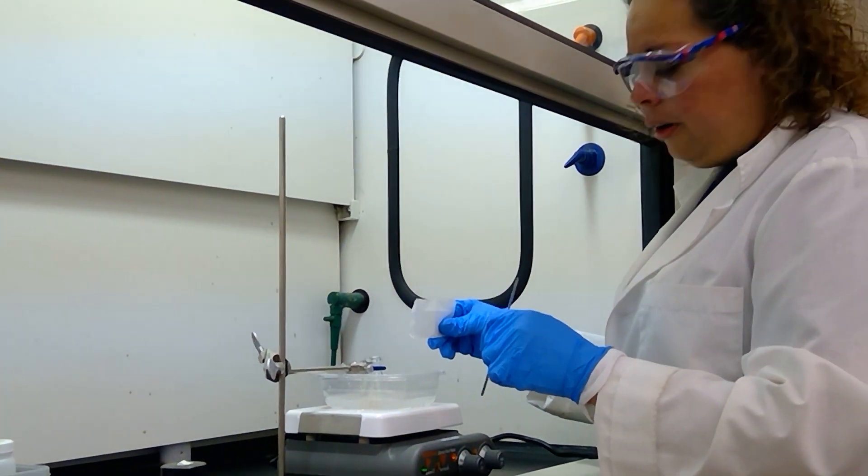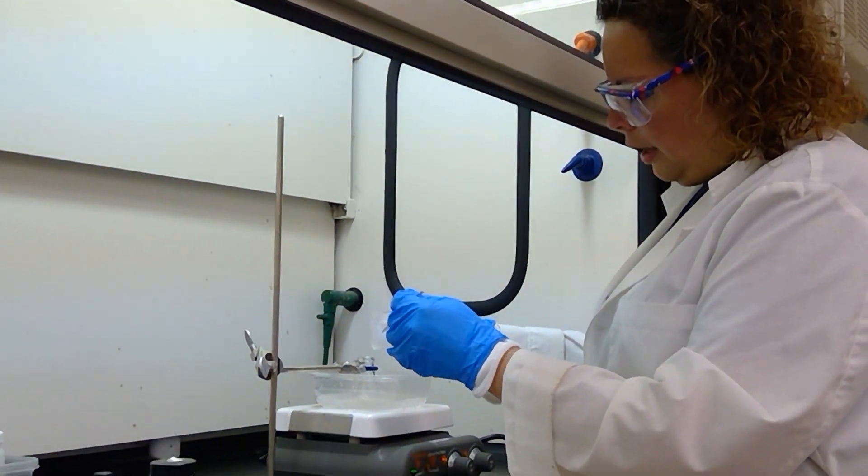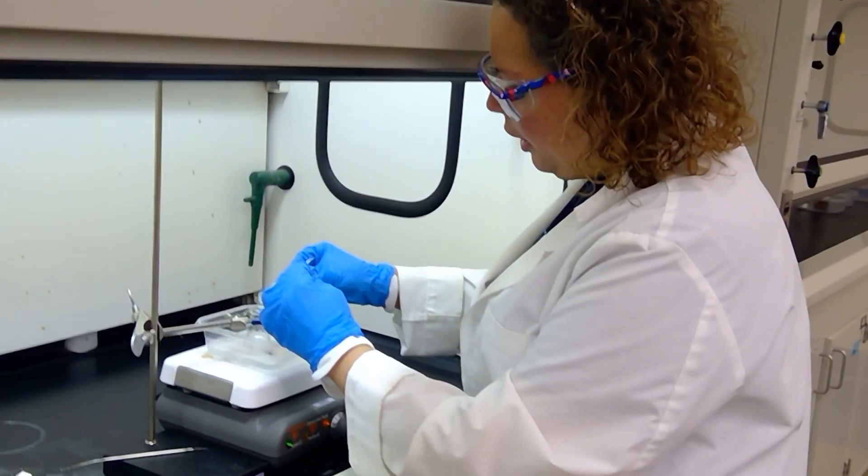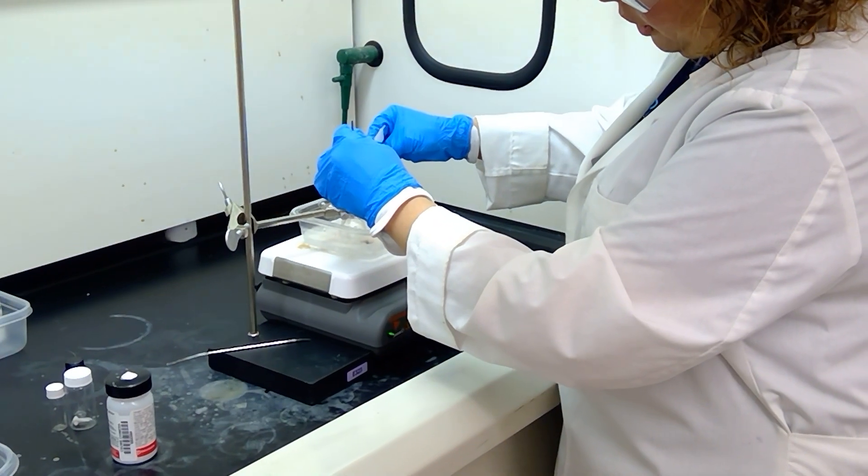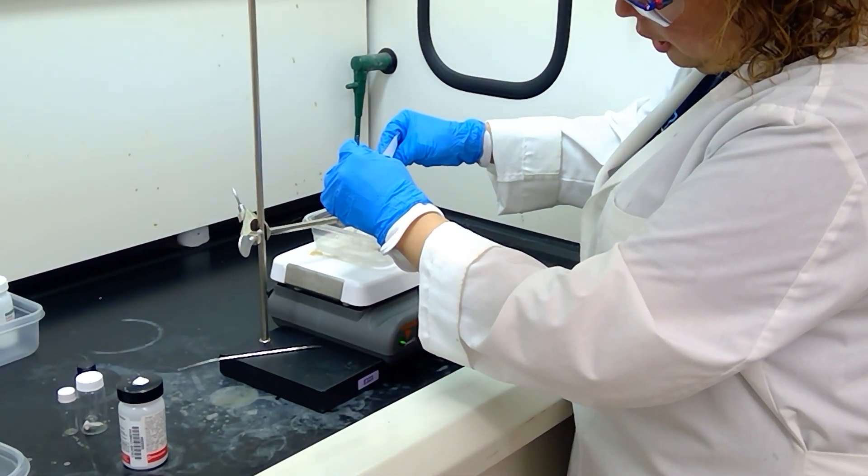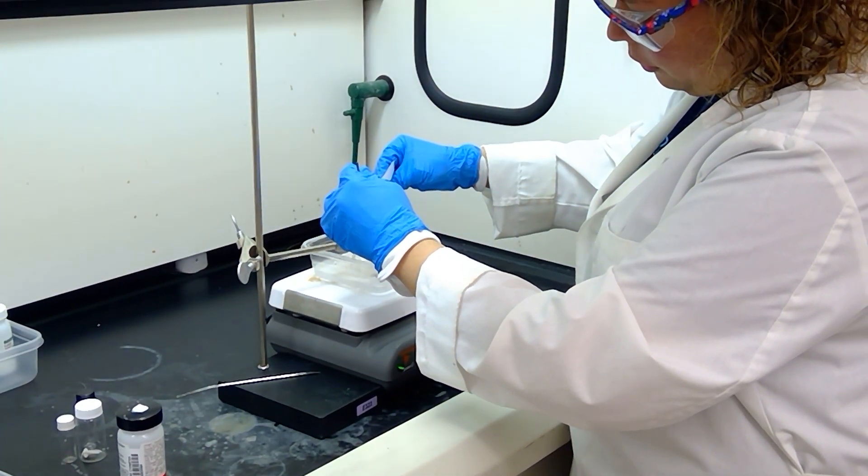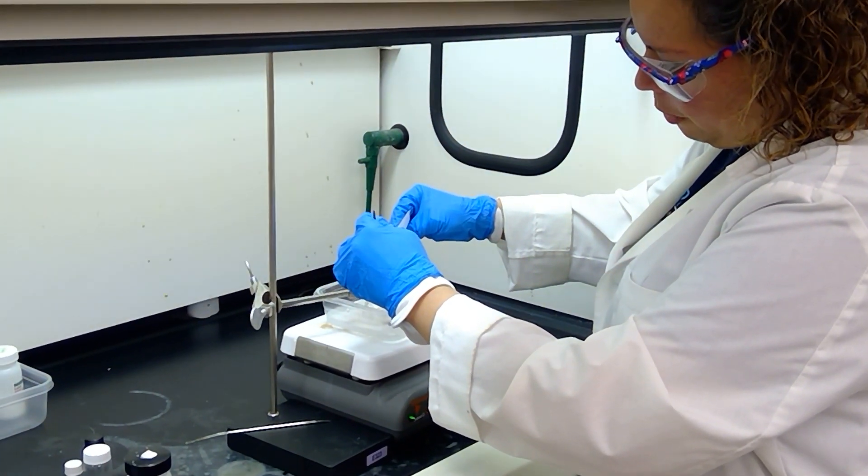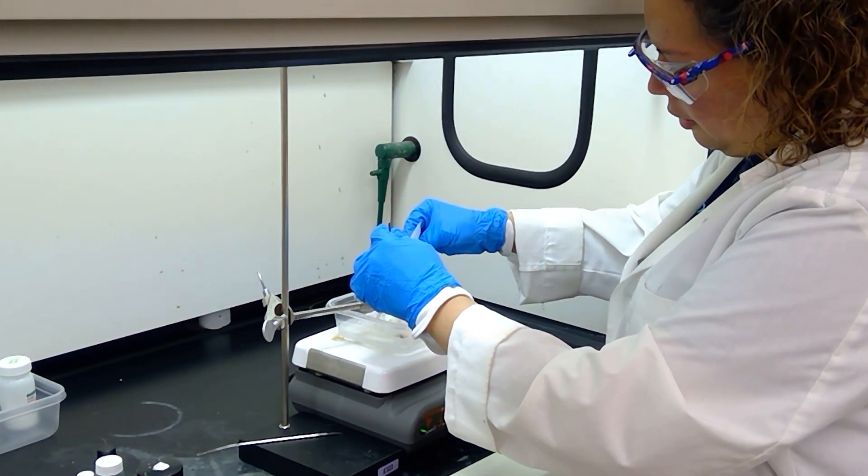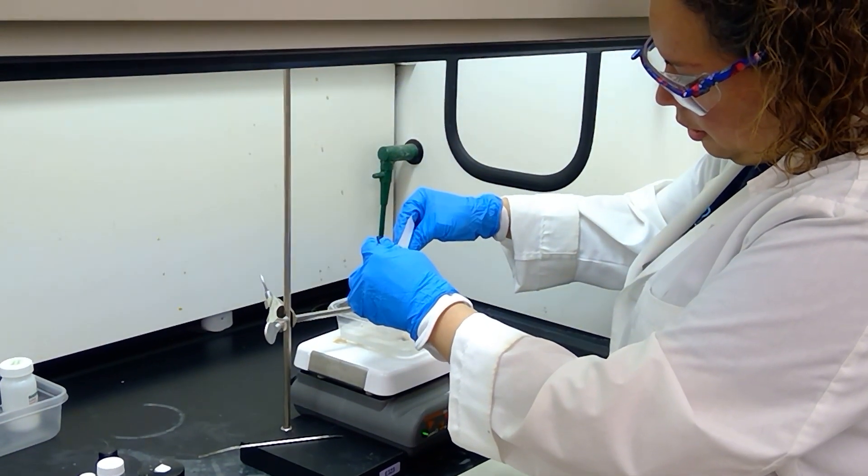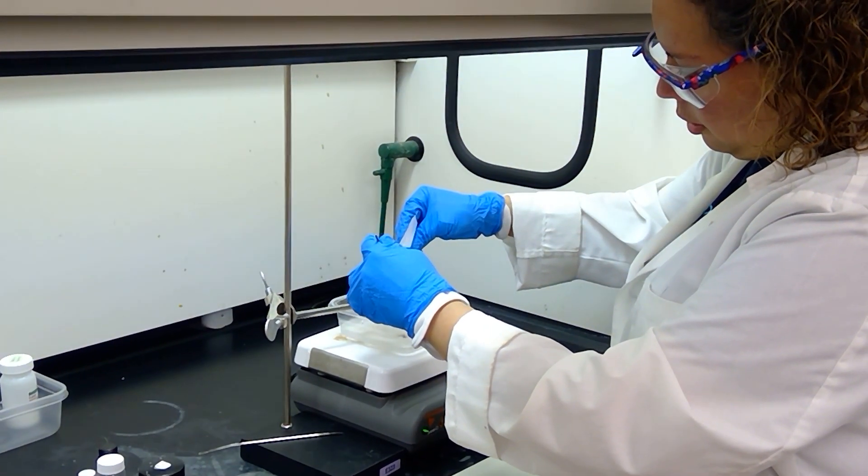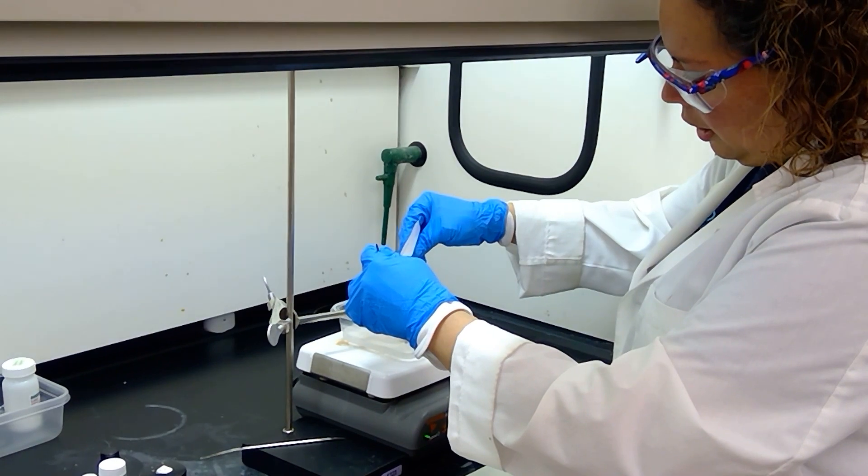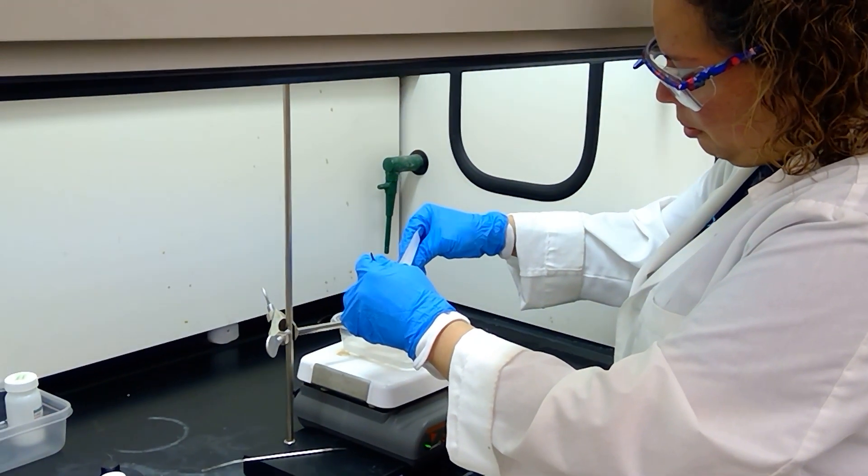Now that our benzophenone has dissolved, I'm going to start adding the sodium borohydride little by little, and we want to do this little by little so that we don't generate too much heat for the experiment. That's also why we are doing this experiment over an ice bath. As I'm dropping it in, you see a little bit of gas being formed in the experiment but not much.